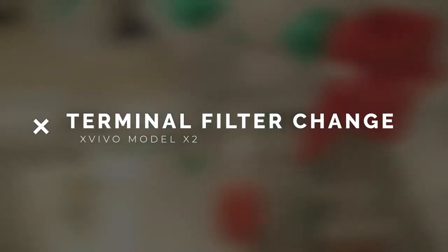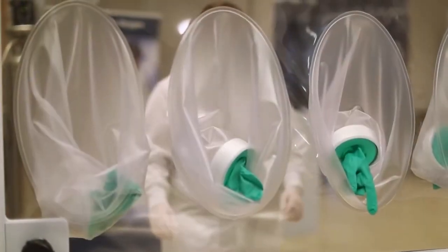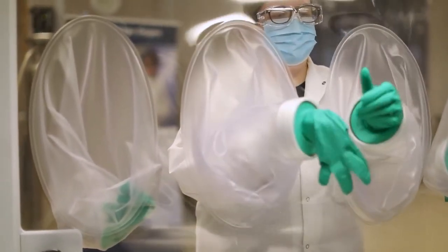Refer to your Xvivo manual for an in-depth explanation of changing terminal filters, also known as external filters. In this video, we will show you how to change the external syringe filter in a process chamber. Before changing a filter, disinfect and transfer a new replacement filter into the module where it will be changed.